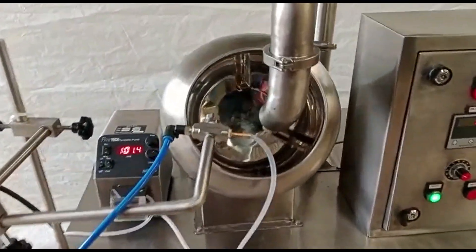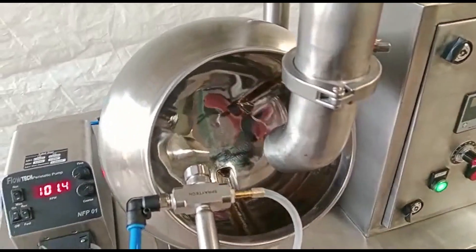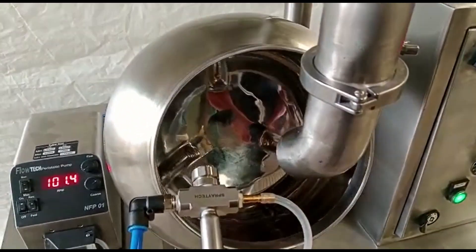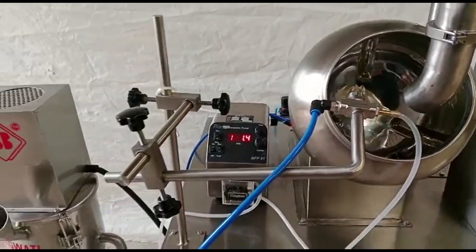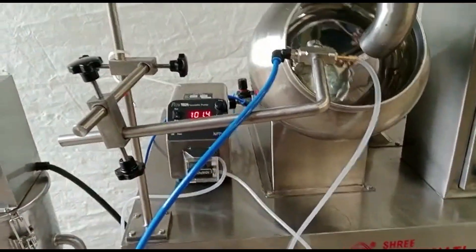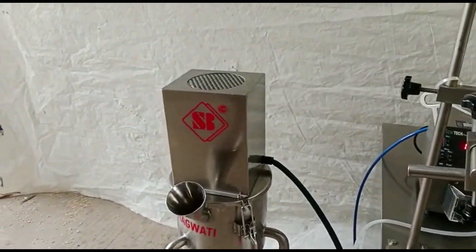The spraying solution tank system is an integral part of this process as it supplies the coating solution to the pan. Remember that the design and components you choose will depend on the specific requirements of your lab-scale coating process.